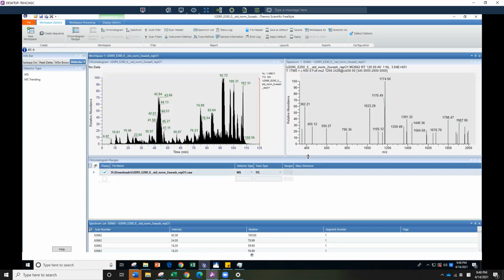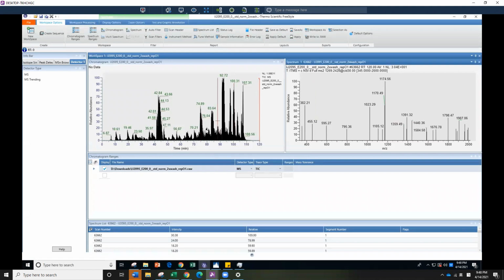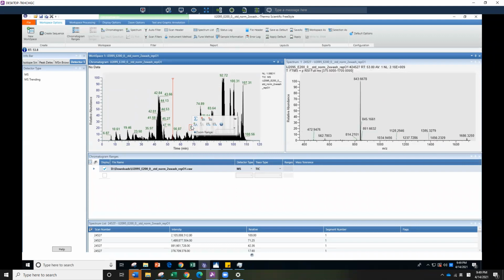It brings up some views here. This is your mass spec file. These are two-dimensional files: your intensity here, and your retention time there. And this is your spectrum. If you put your mouse here and start walking through using the right arrow key on the keyboard, you can see the spectrum is changing.